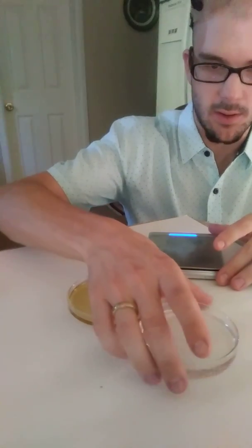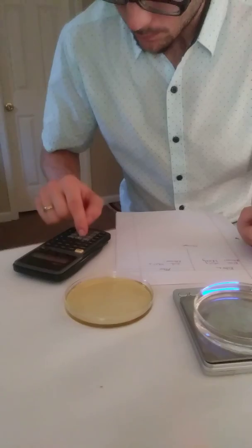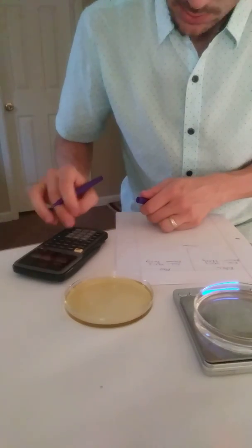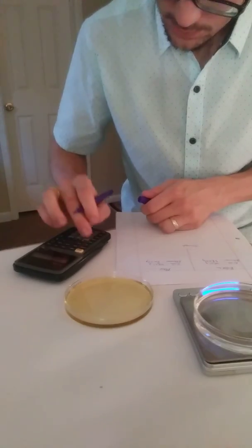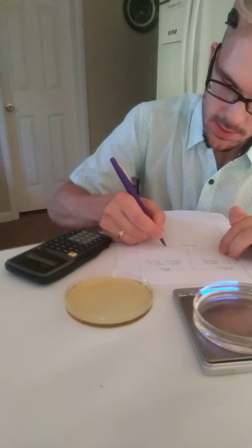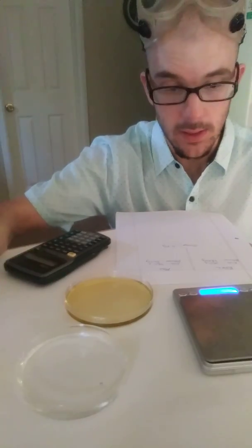Let's go ahead and mass our ethanol now — it's still a little warm. The mass of our ethanol with the dish is 74.58 grams, which means the mass of our ethanol is now 34.37 grams. The difference is negative 4.60 grams. Our ethanol became less massive — it has lost mass. We also observe that our BTB turned yellow, which is the same thing that happened in the soda investigation.